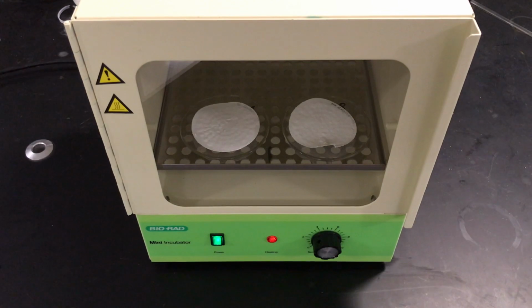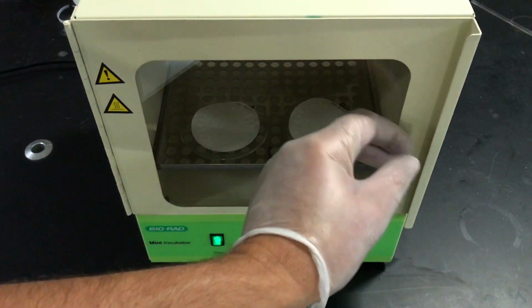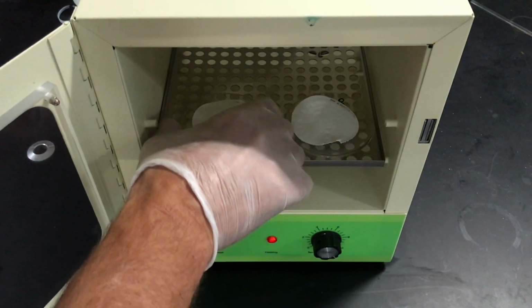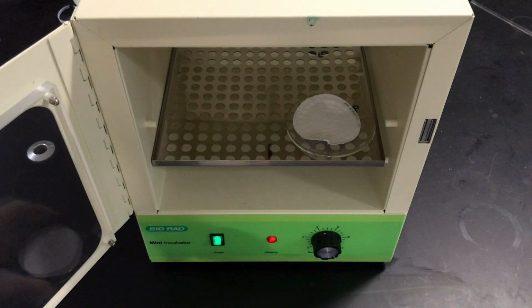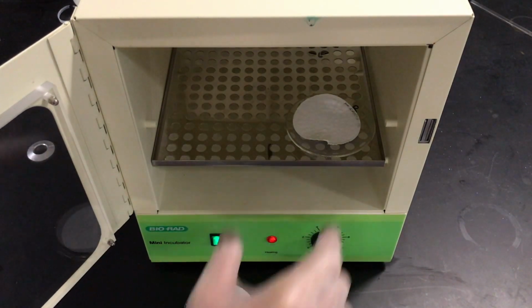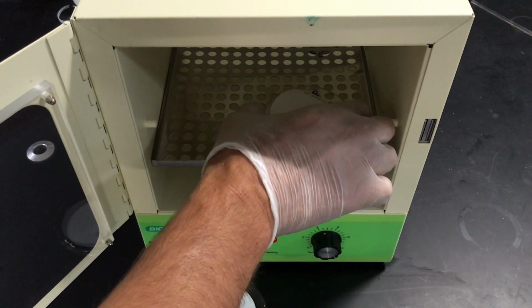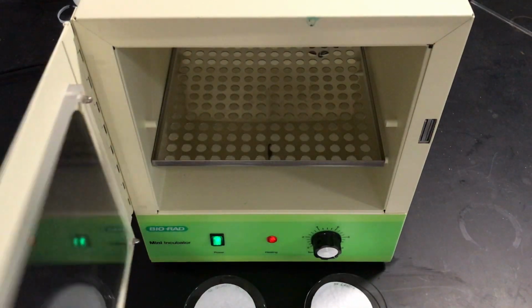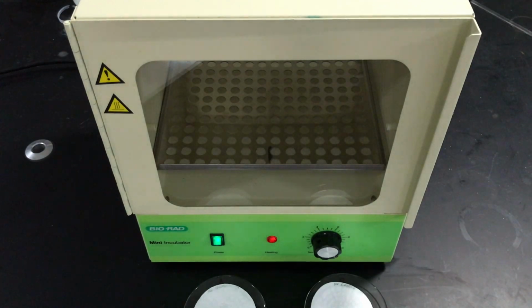So after about 45 minutes, I'm going to remove our samples of dried calcium carbonate from the oven. There's our A. And carefully keep the chalk. And there's B. And now we're going to mass them out for a final massing.